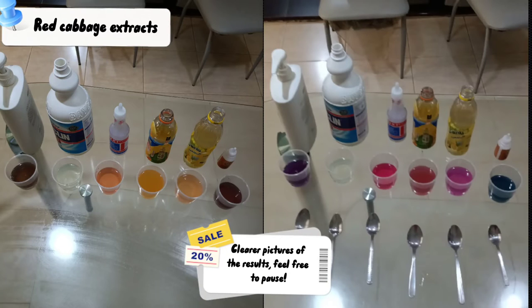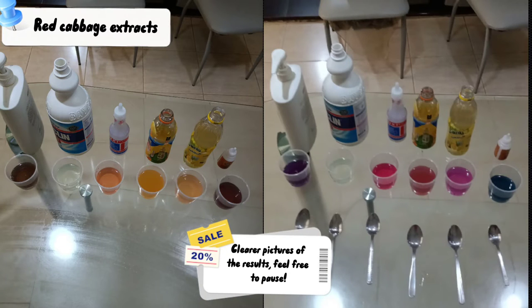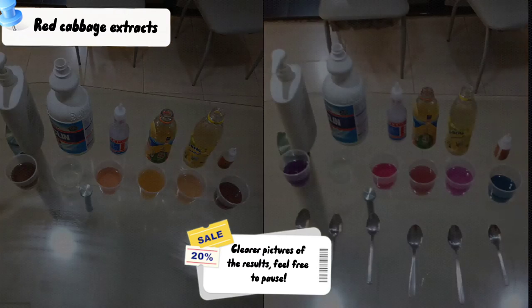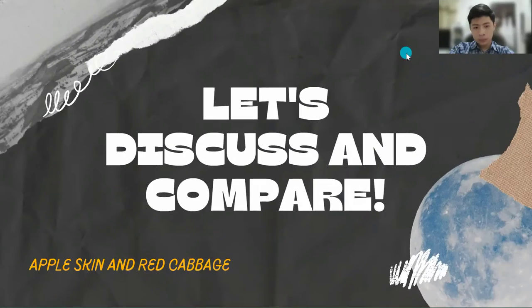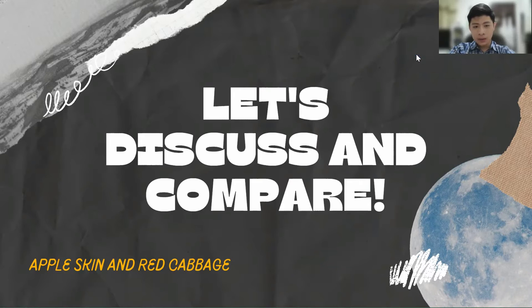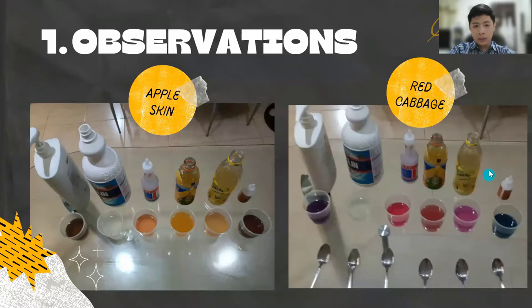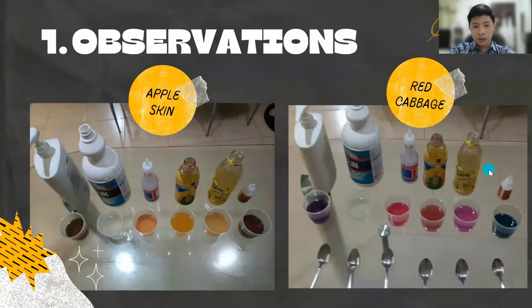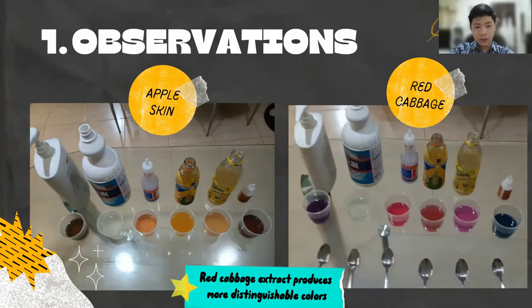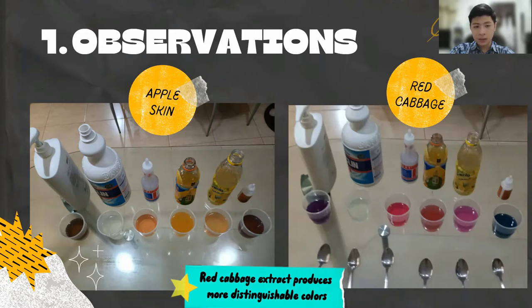Here are clearer pictures of the results. Feel free to pause the video to get a better observation. Now let's discuss and compare the two natural indicators. The first comparison: just by observing the results, we can already tell that the colors produced by the red cabbage extracts are more distinguishable than the apple skin extracts.